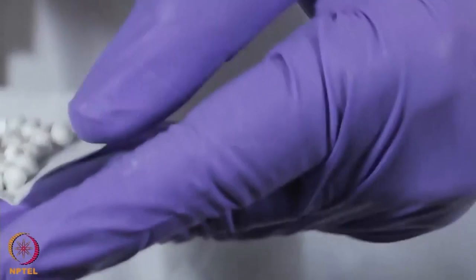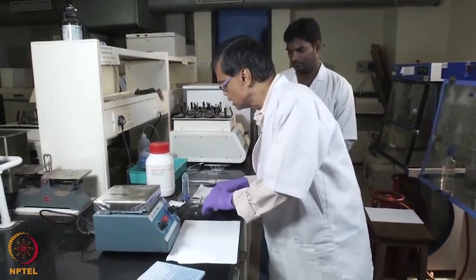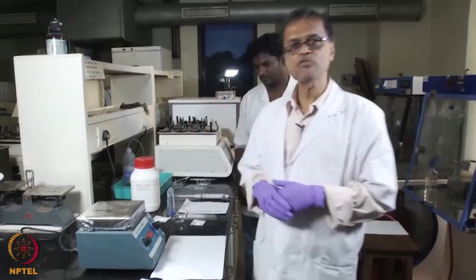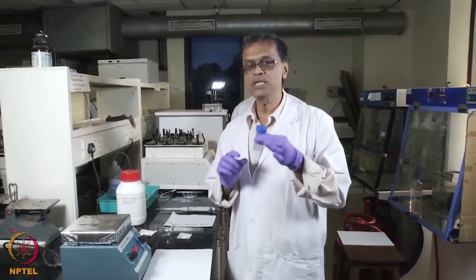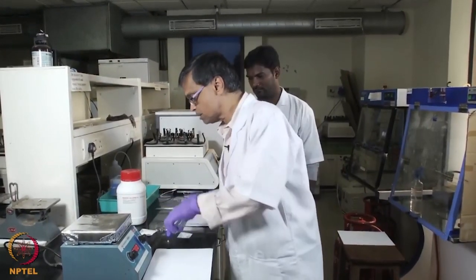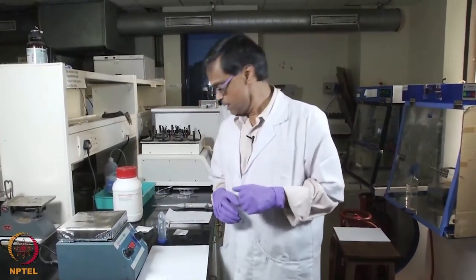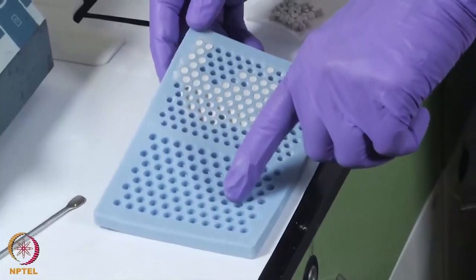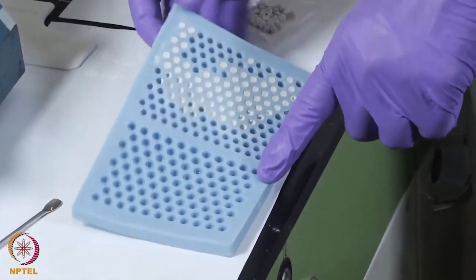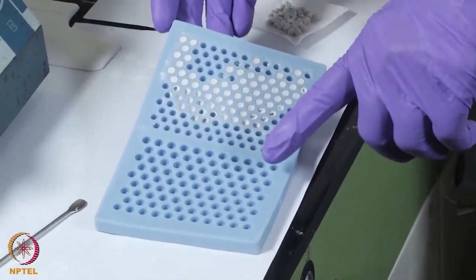We can also incorporate drugs and antibiotics into it so that the drug gets slowly released and it prevents biofilm formation. You need around 700 microlitres of water for about 1 gram of calcium sulphate. We need to use ultra pure water here. I have taken 5 times, that means 5 grams of calcium sulphate and 3.5 ml of ultra pure water, because here we can make 4 mm beads or 5 mm beads depending on which mold we use. If you want to cover as much area, then you need to correspondingly take the same ratio.